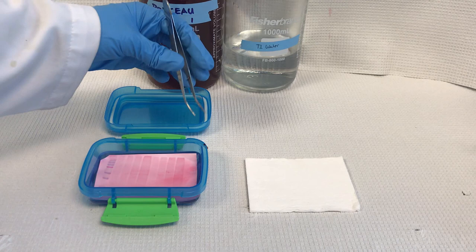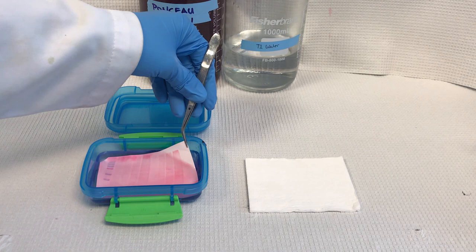Place the membrane on filter paper to dry and visually inspect for a successful transfer.